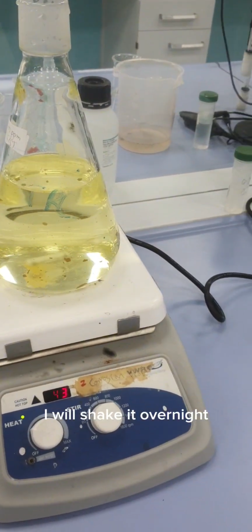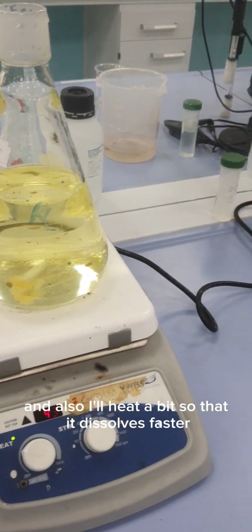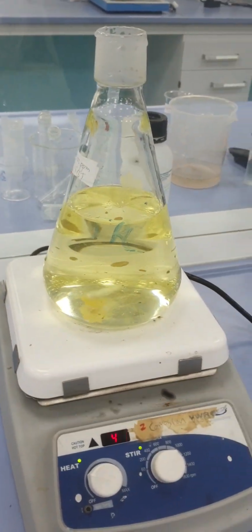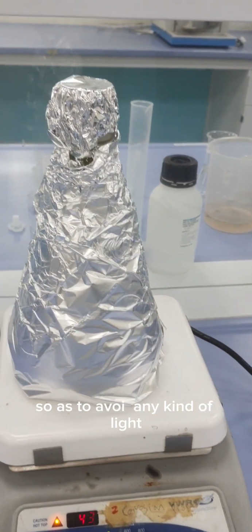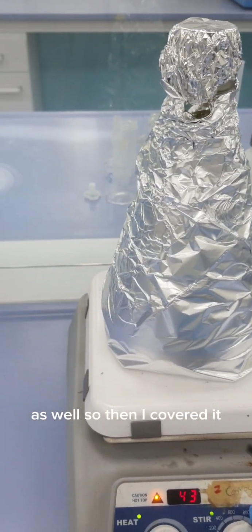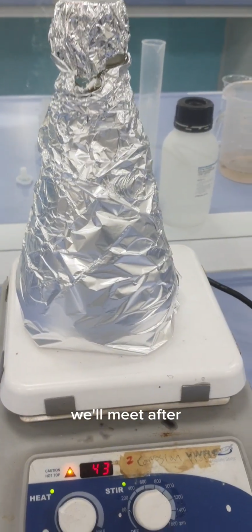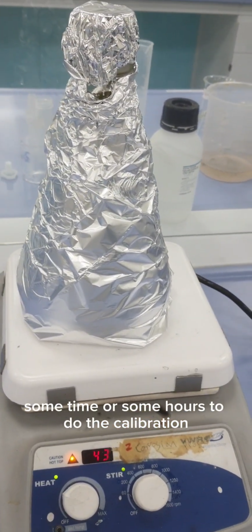I will shake it overnight so that the mixture is homogeneous, and also I'll heat it a bit so that it dissolves faster. Also, I have covered this so as to avoid any kind of light, or you can say any kind of photo activity. So I've just covered it. We'll meet after some hours to do the calibration.